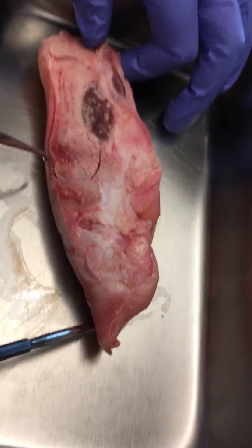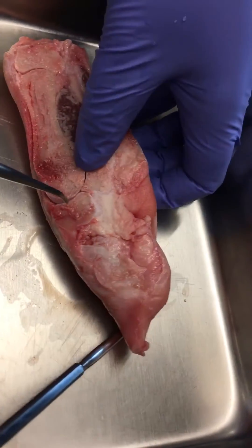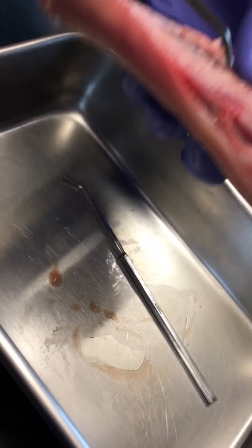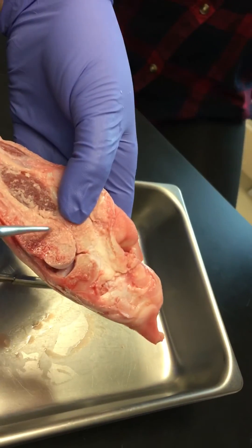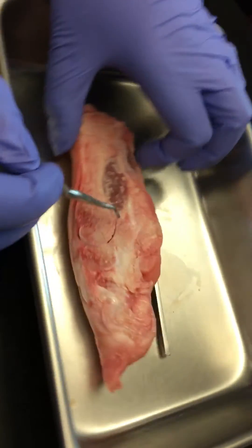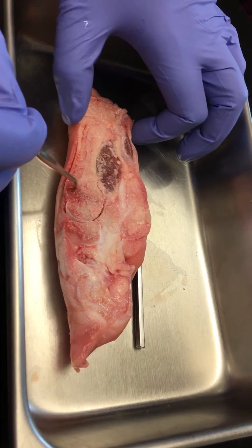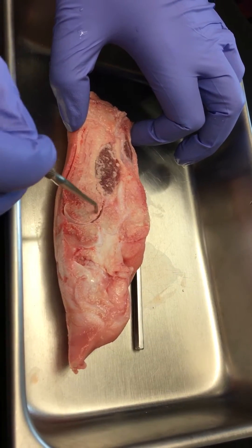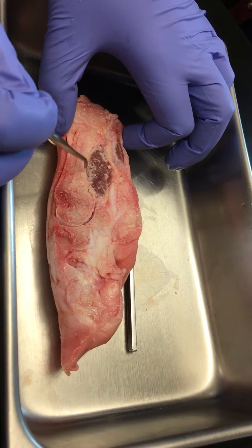You can see a little line that sort of goes across — it's made out of cartilage. It's sort of hard to see; sometimes you can change the light and see a little bit of the cartilage right across here. So this side is the epiphysis. You'll find some spongy bone in here, and the rest of the outside of the bone is going to be compact bone, which is really nice and hard.